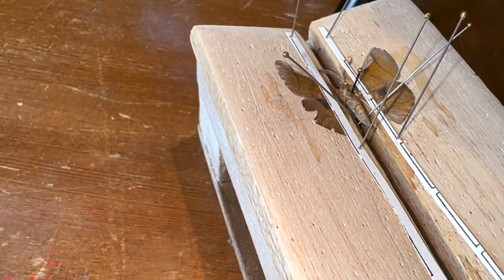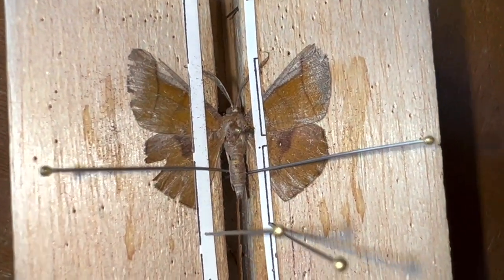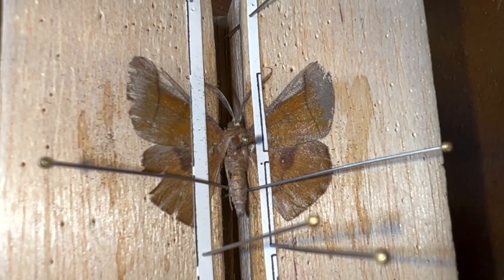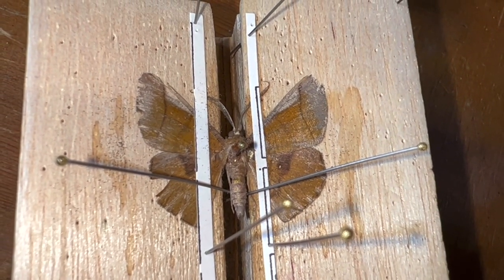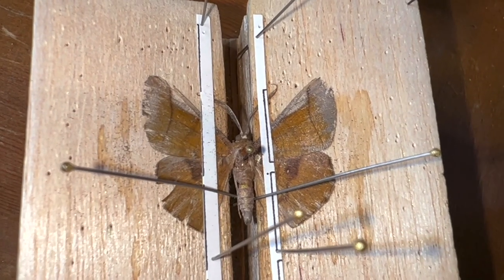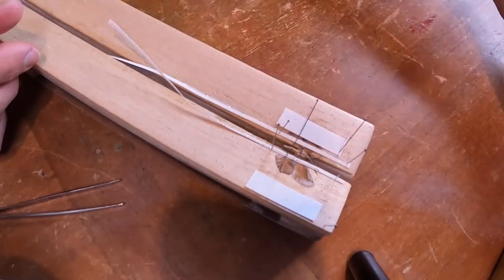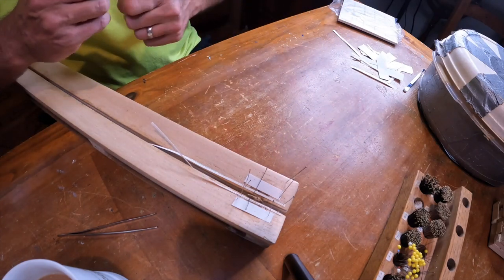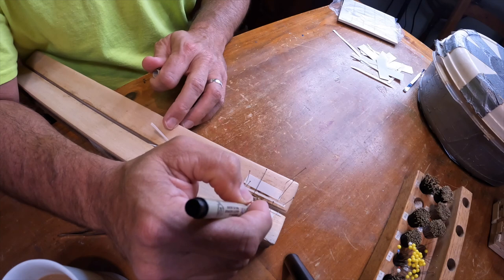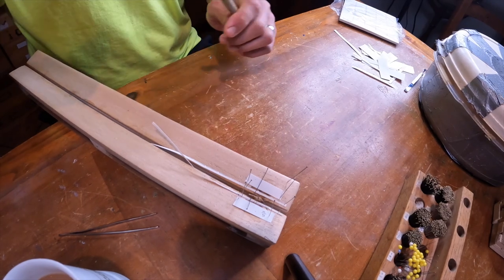Let me get this pin out of the wing. There are a few little chips out of the wings, but this is definitely a new species for our project. I'm looking forward to seeing what it is and getting the smart bug guys to identify the species. I'm going to cover the wings now, and today is the 21st so I'll put 11/21 so I know what date I mounted this.